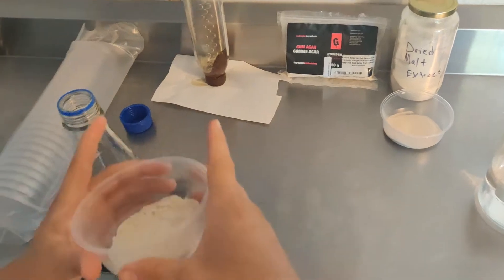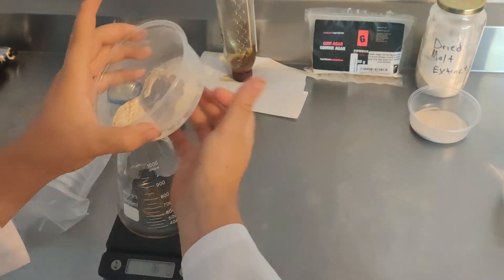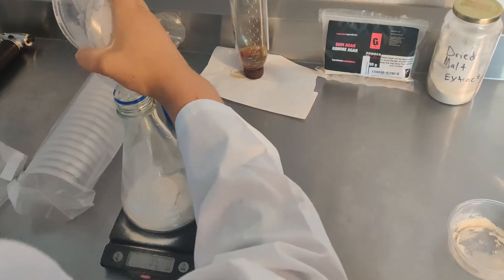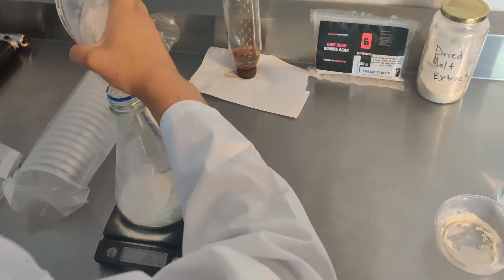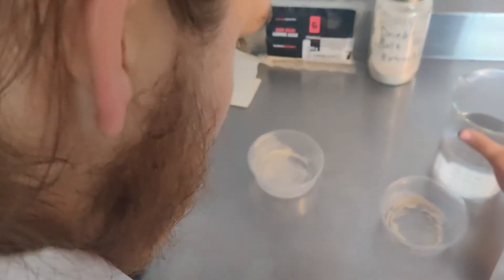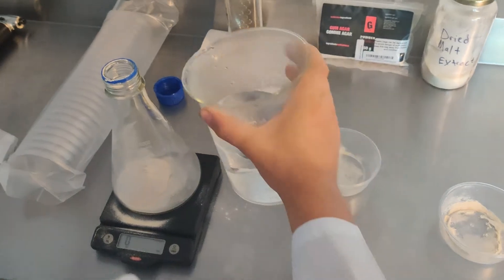Next we'll add the agar powder, the dried malt extract, and finally 500 milliliters of hot water.